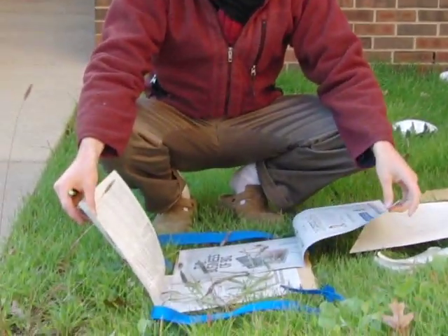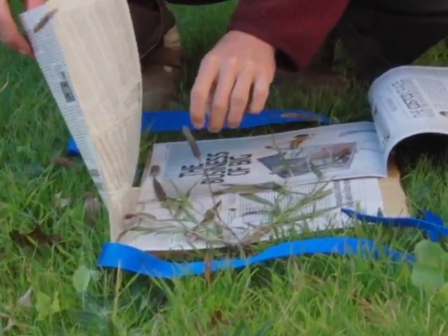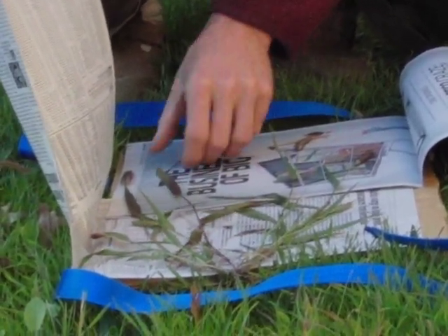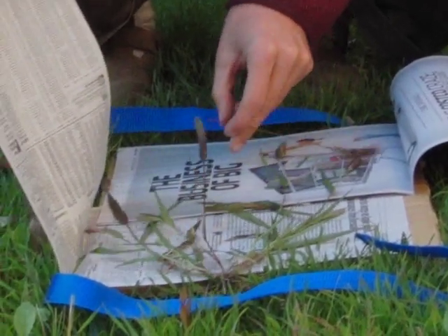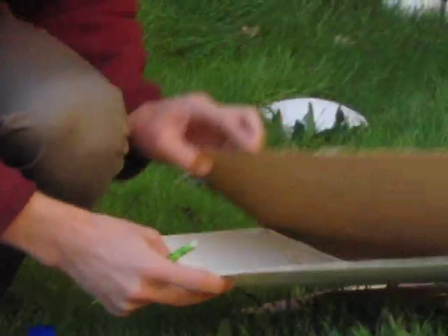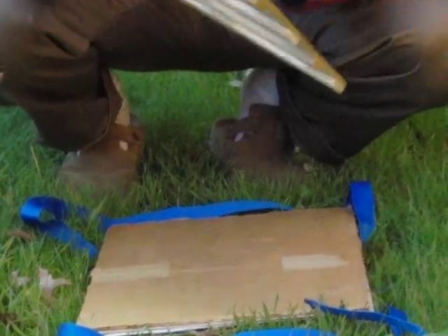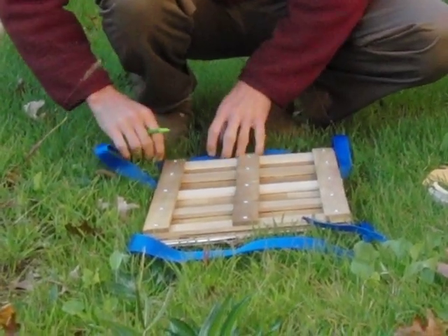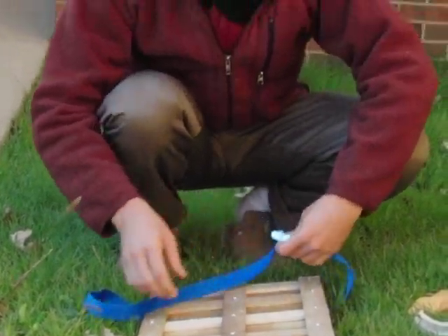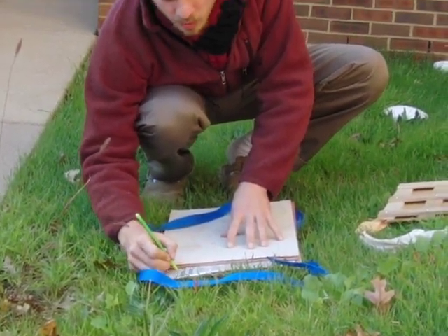Get your newspaper and set the plant in it. Depending on the size, you may have to bend some of the peduncles or the whole plant to make it fit. This is a medium-sized Setaria viridis with one main peduncle that's just a little too long, so we bend it down. Fold your newspaper, add blotter paper or cardboard on top, and make sure everything is under the cardboard — you might need help since it can be hard with just two hands. An important thing: write the collection number — Smith1 — on the newspaper so you know what it is when you get back to the lab.